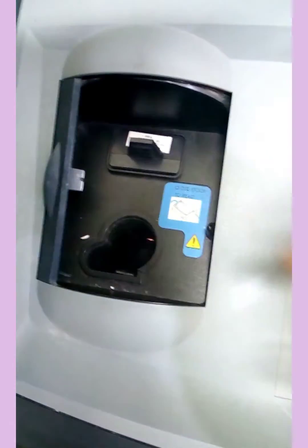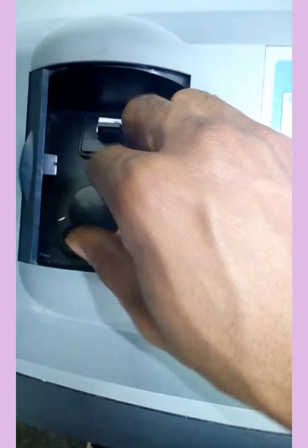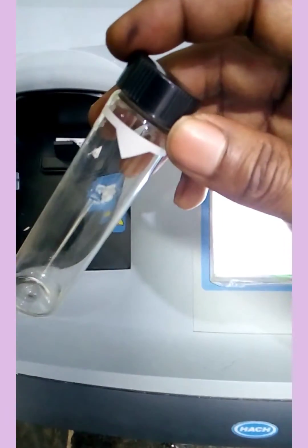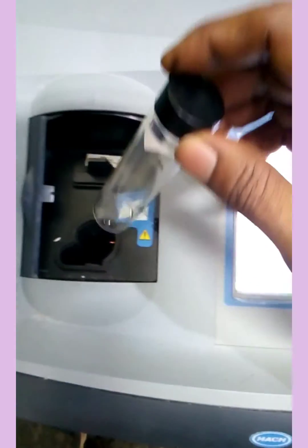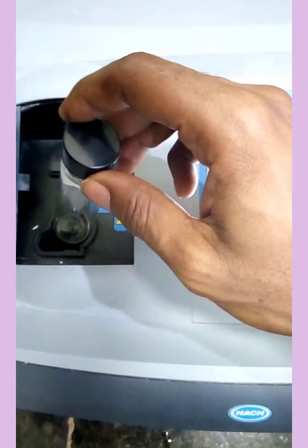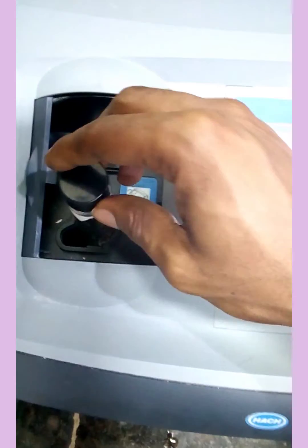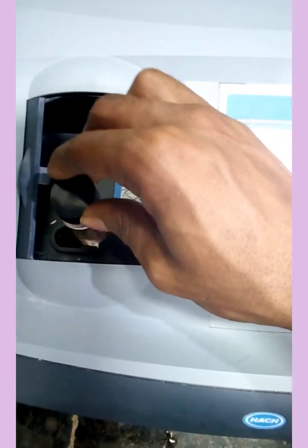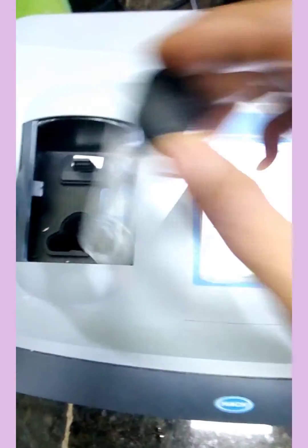The turbidity meter has a sample hole where you insert the cell. You have to look in the direction of the cell, and the cell must face the direction of the light. You can see the light is positioned there inside the meter.